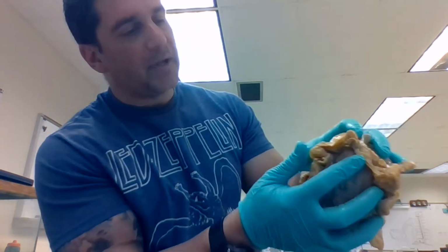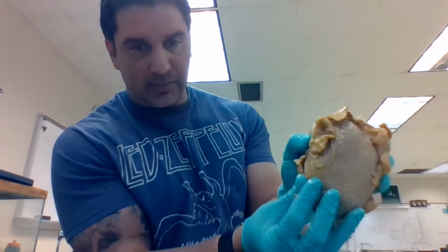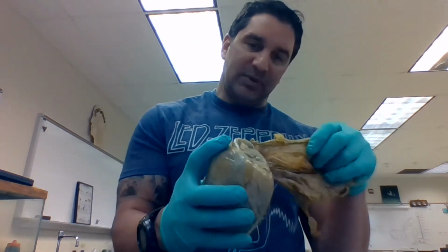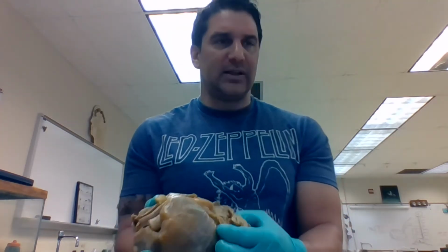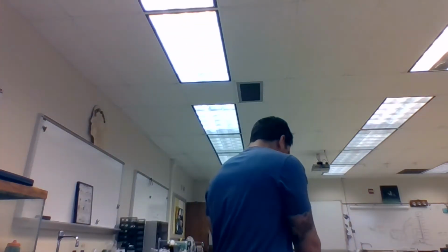And if you remember from early on in the year, we talked about pericardium, right? Parietal pericardium and visceral pericardium. Well, this is the parietal pericardium. It's surrounding the heart. So if you remove that, that exposes the muscular organ of the heart. Okay, well, that is the heart. So the space between this parietal pericardium and the visceral pericardium, that's the pericardial cavity. That has that serous fluid in it, that pericardial fluid that helps reduce friction, allows the heart to beat in a relatively frictionless environment.